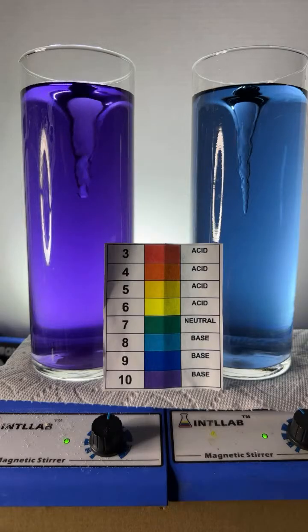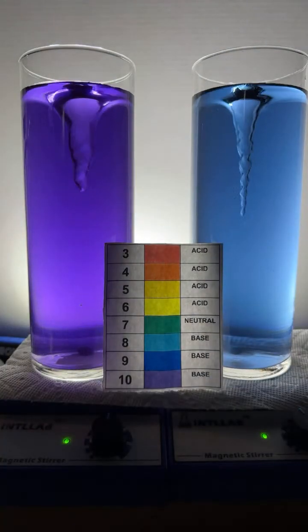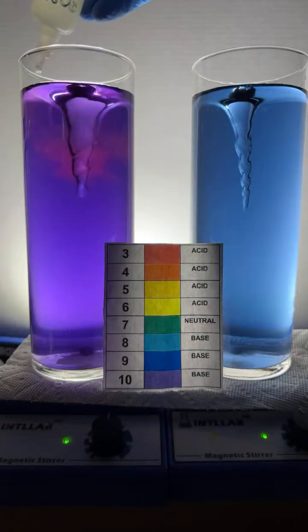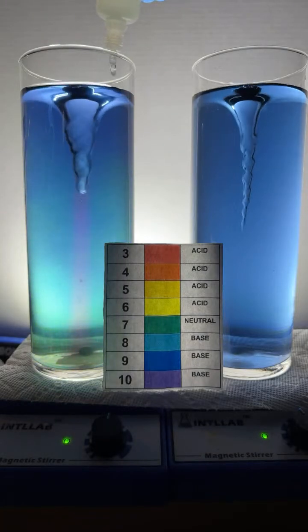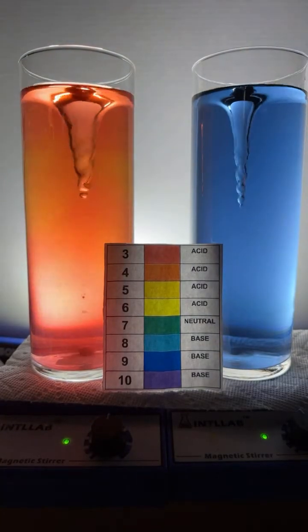Oh, curses. Yeah, I'm just going to have to turn it this way. That's what we're going to do. I'll just turn it back and forth. Here we go. Let's start adding some acid. Over here on the left, added 2 drops of acid. Watch those color changes. Nikki, I got it measured a long time ago. I measure somewhere in between, 120 to 150, depending on the day.